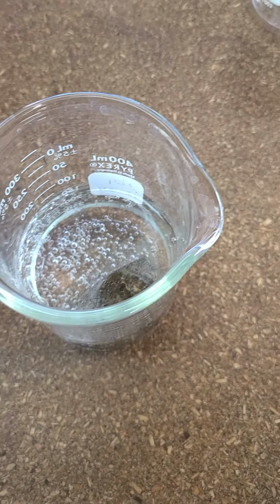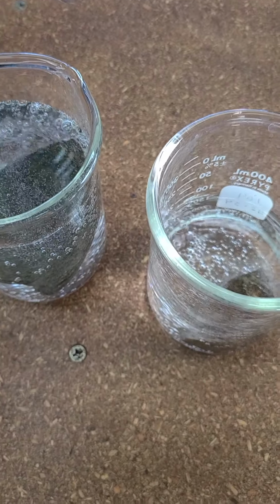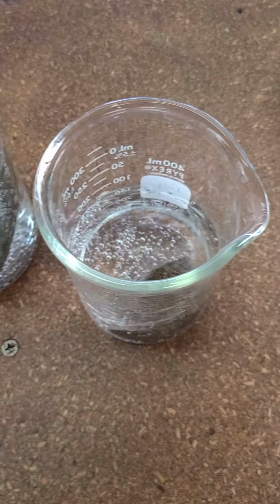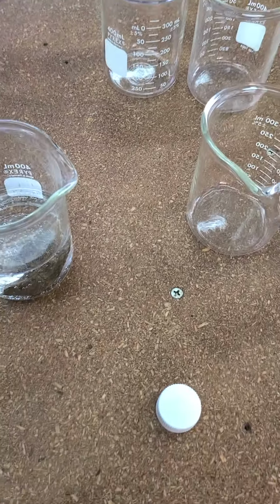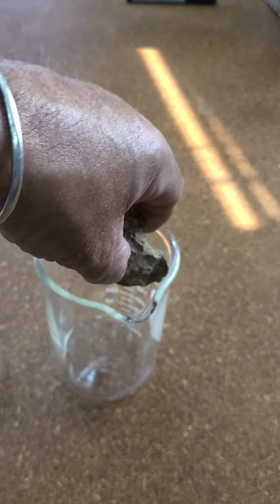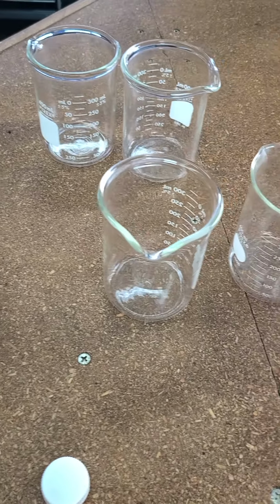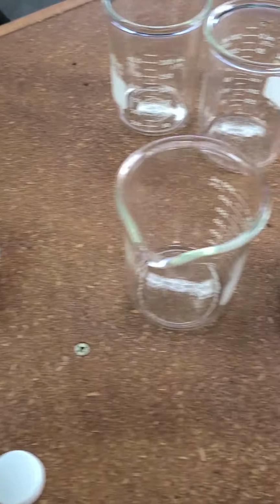All right, so then on the last one, I think again I'm just going to use 3 different beakers. I have a couple extras here, and I'll put rock type C in there. I'll put that one in through there, and rock type B in through there, and then finally my rock type A through there.